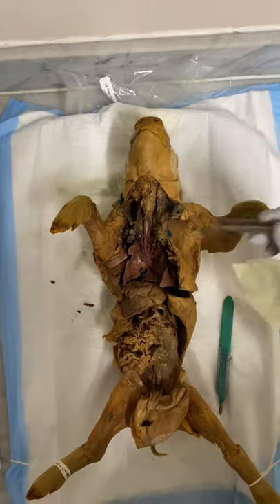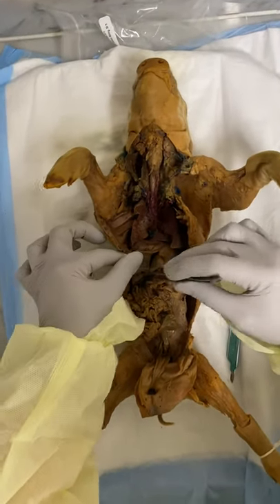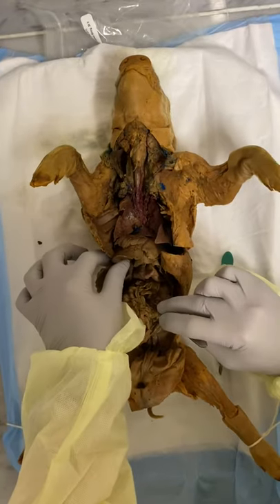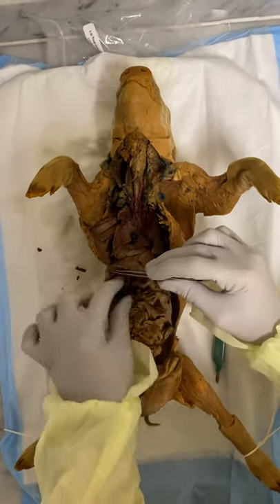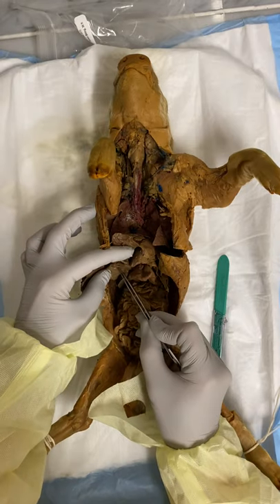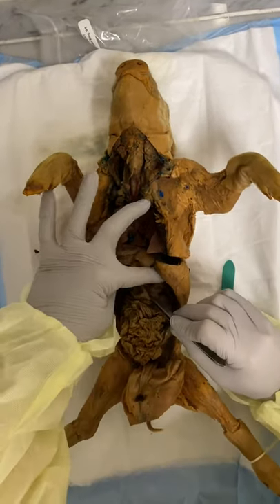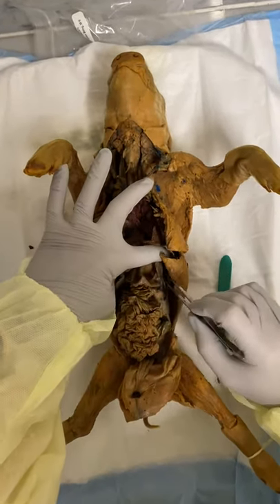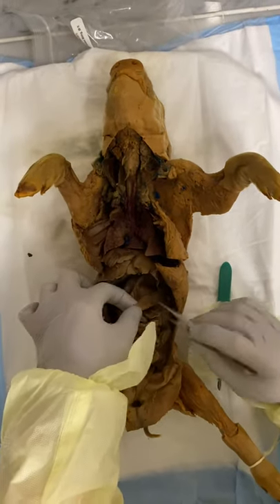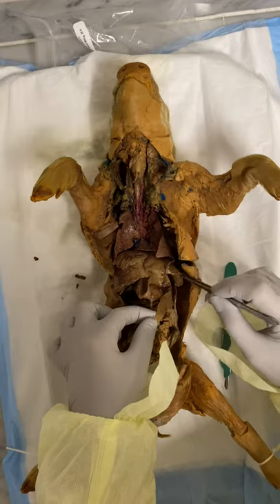And then I go down to my liver, this big thing here — one, two, three, four lobes. The gallbladder is this little guy right here. My stomach is right here. Right next to that is my spleen, nice and thin over here, or the diaphragm.